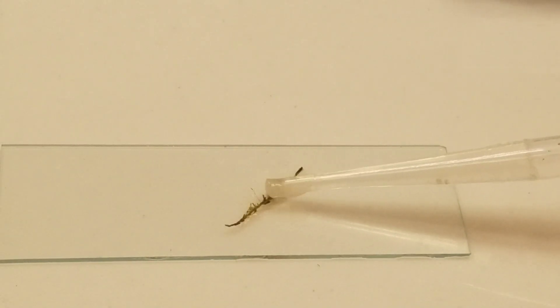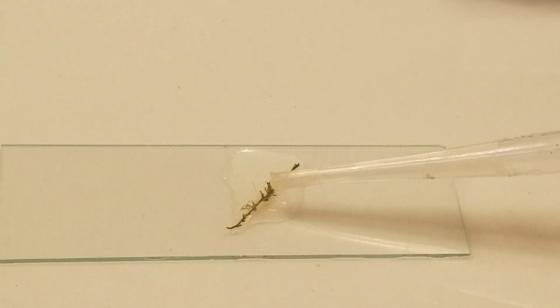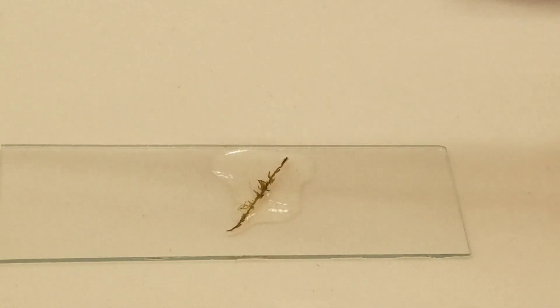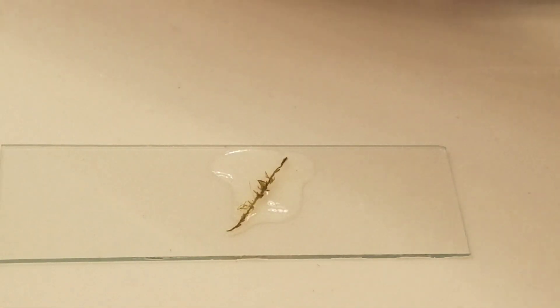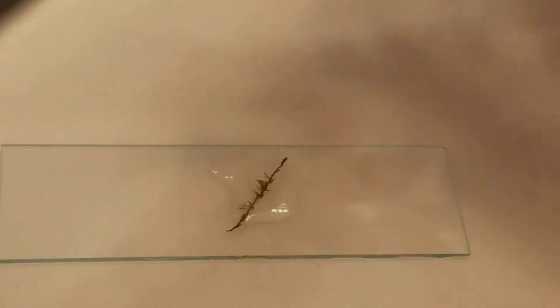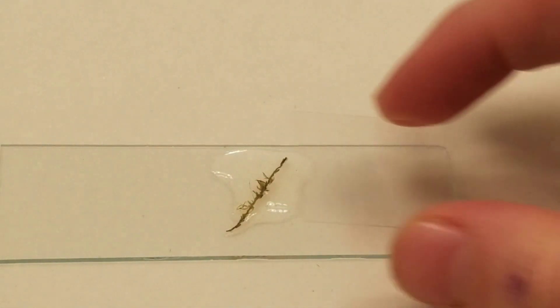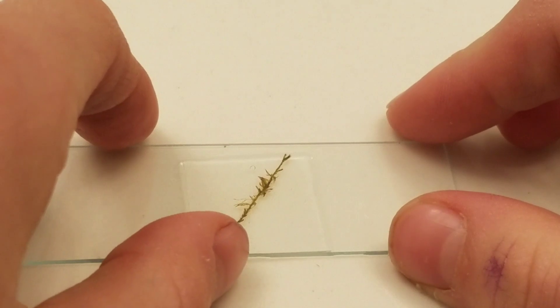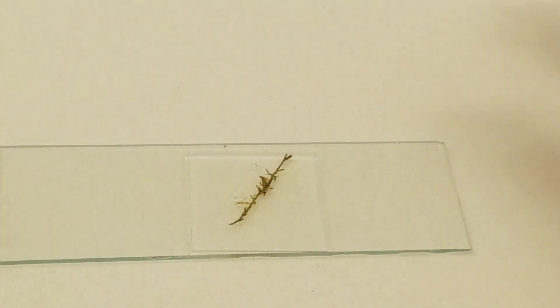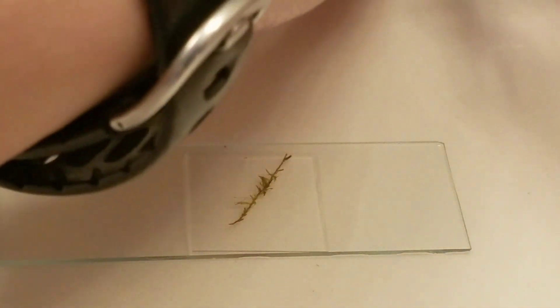So what I'm going to do is take some of the water from the sample — the milk-induced water — and put it on there just to kind of deal with the slide, because the slide won't stick without water. And it is the milk-induced water.